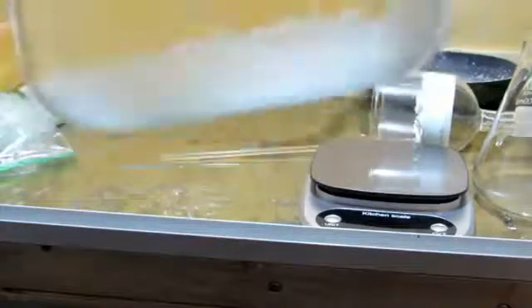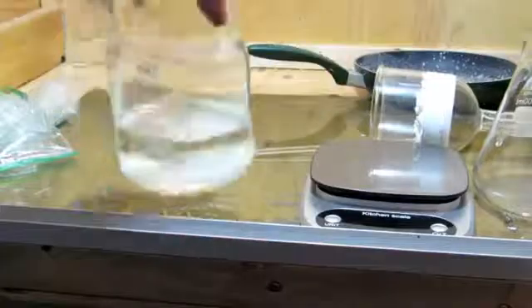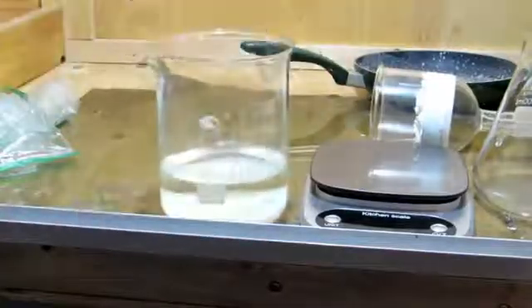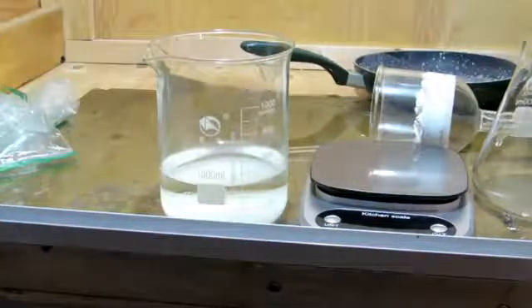Anyhow, we'll go ahead and filter this again, because this is clearly not phosphoric acid. Phosphoric acid is very soluble in water, and should not precipitate out at this current stage. So, I'll go ahead, filter it again, and then boil the solution.